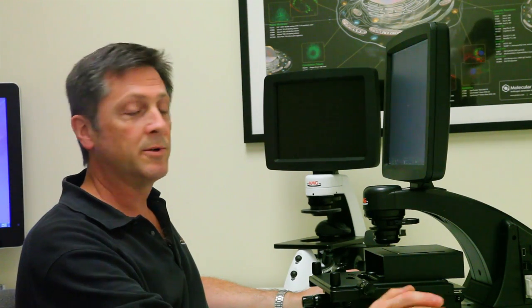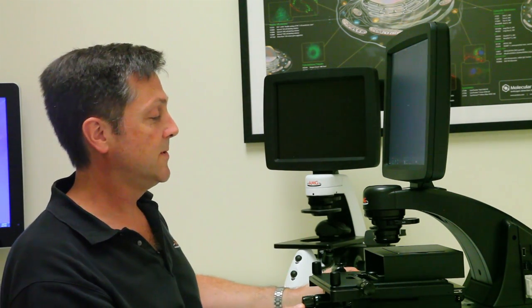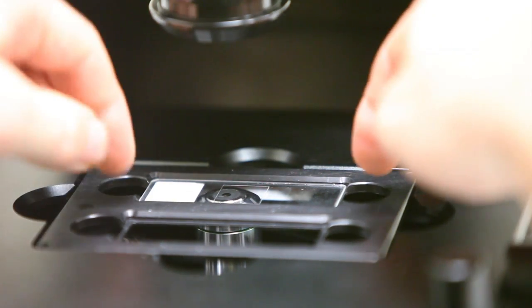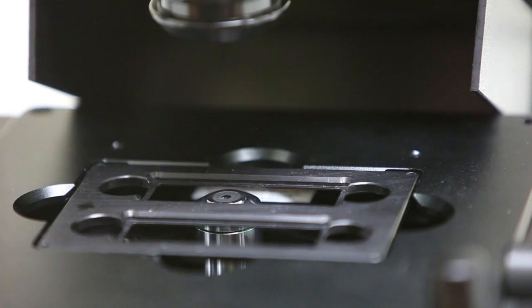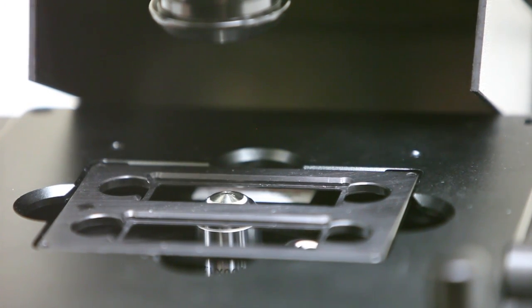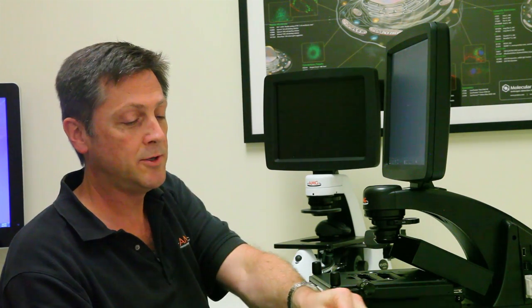And then what we're going to do is switch over to our 100x objective, put the oil on the objective, and bring that into focus with the sample. So in order to do that, I'm just going to reach in here. I'm going to have to remove my slide now to get access to the objective. So I'll just set that aside here for a minute. And I'll switch over my objective to the 100x. And that 100x, I'm going to lower the objective by dropping down my focusing knob here until it goes to the end. You hear that click, that's the end of the focus range.